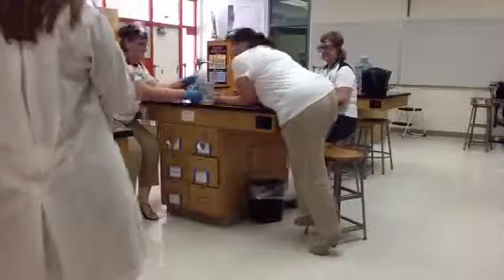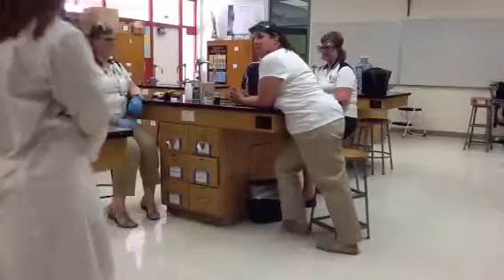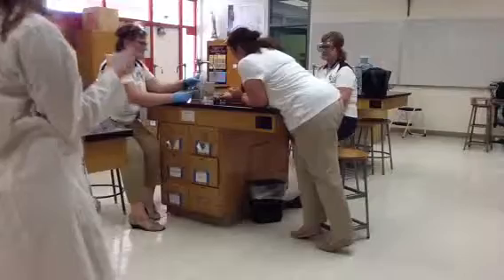Okay, no, okay, you guys can't mix that. Listen to what I'm saying. Where you're allowed, we're going to mix things differently at a different time.